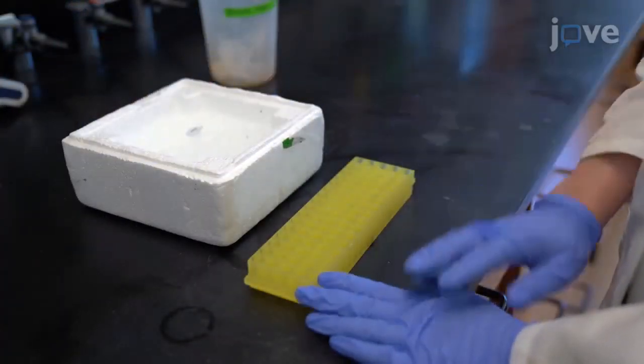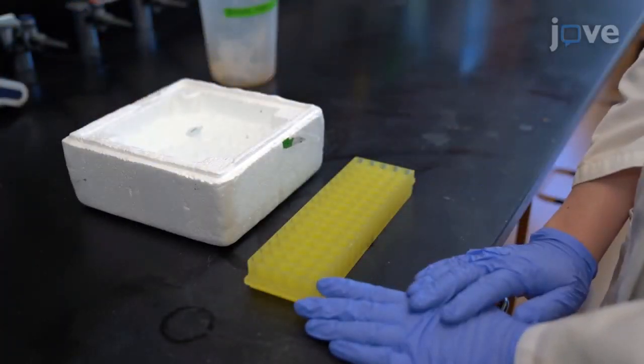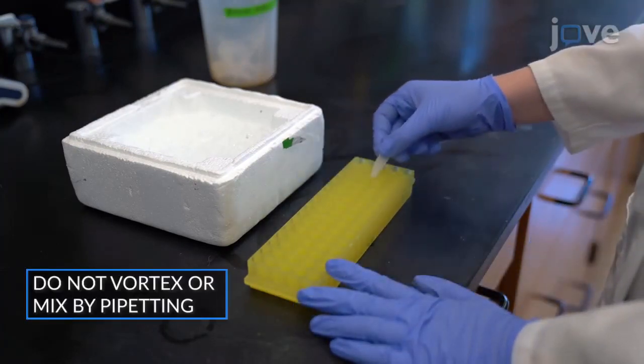Incubate the mixtures on ice for 30 minutes with gentle mixing every 10 minutes by scraping the tubes across a microtube rack.